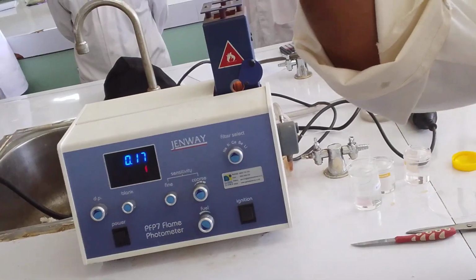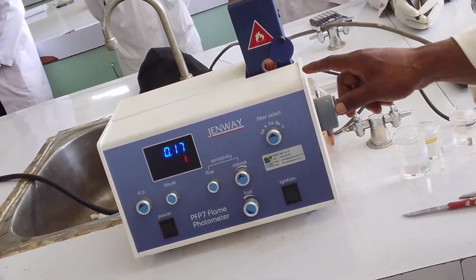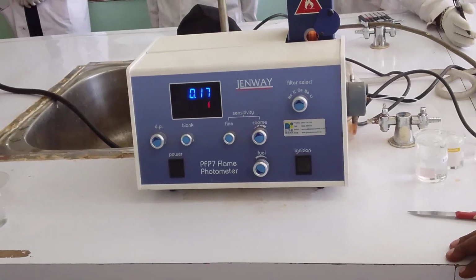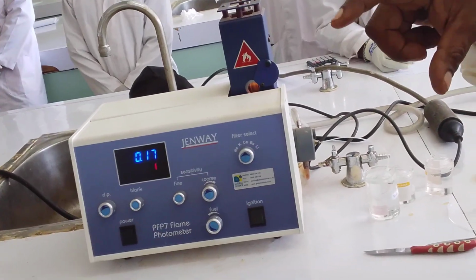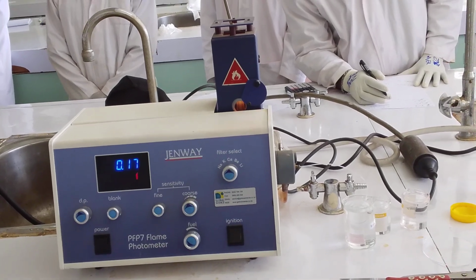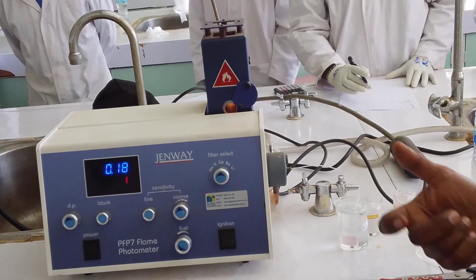And if I look at the sample on the board now, the readings, I would know exactly how you have prepared your sample, where you have gone wrong. And never say, oh, it should be okay. Analytical balance, weigh the exact amount. The measurement, meniscus reading, it should be exact. Concentration, when you get them together, this machine will tell exactly how much of what you have prepared. So be precise in your measurements.